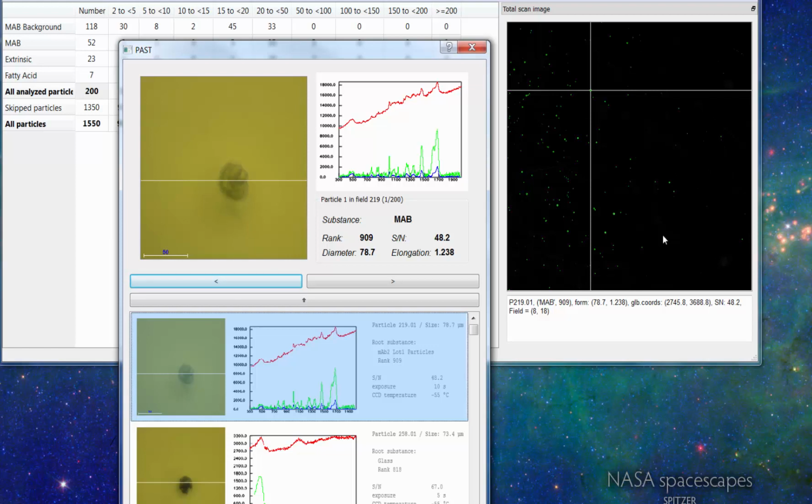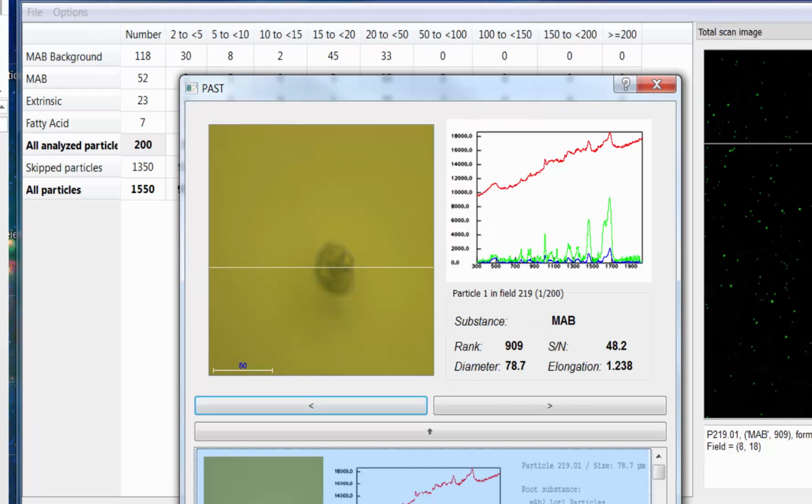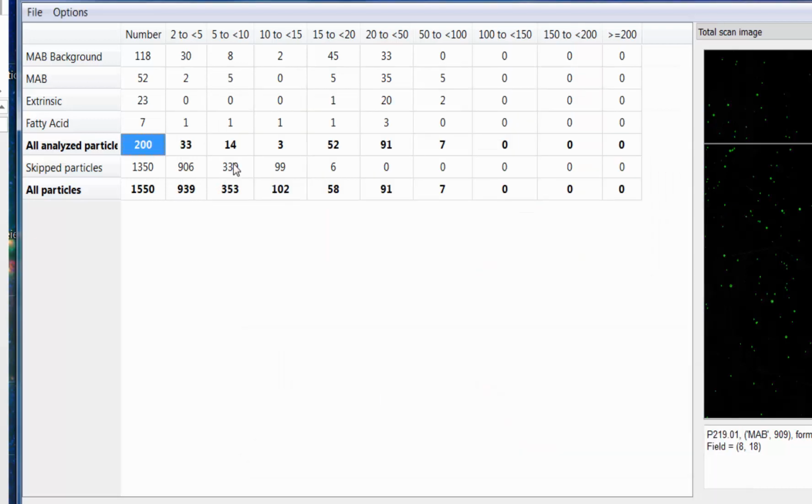Since the sample was over the shelf life, we also find several fatty acid particles that come from polysorbate hydrolysis, or that were polysorbate hydrolysis products. We have limited the analysis to 200 particles. We do see a particle size distribution here, and we have set up the analysis in a way that we come from the largest to the smallest particle.